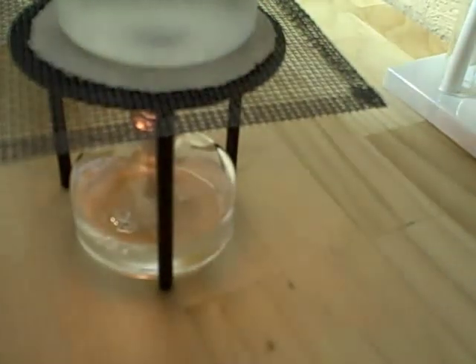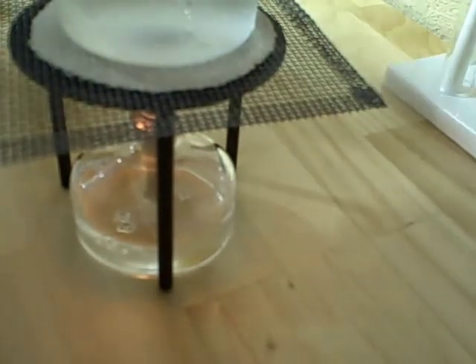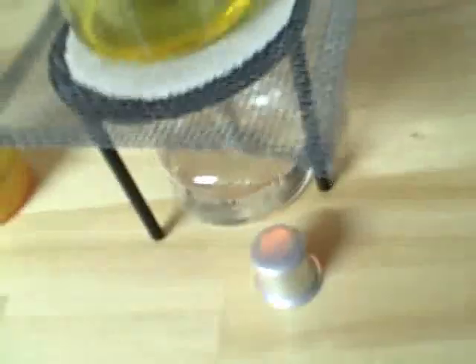You'll want to do this until it's yellow. It will be yellow just because of the impurities in this vinegar, however it's nothing to worry about. A little bit later I got this — that's the authentic yellow color, and that's what we're looking for. So once you have that, you can extinguish the burner flame.